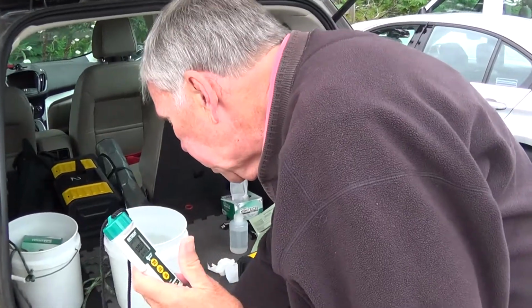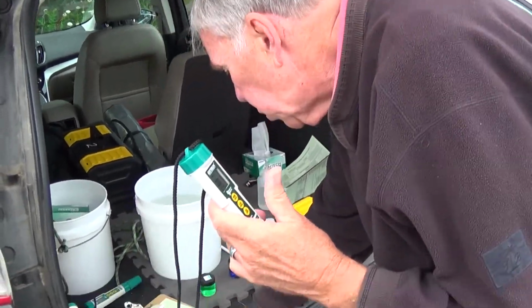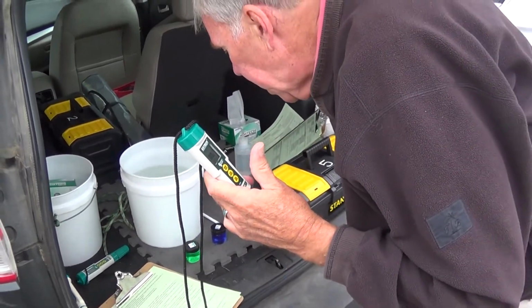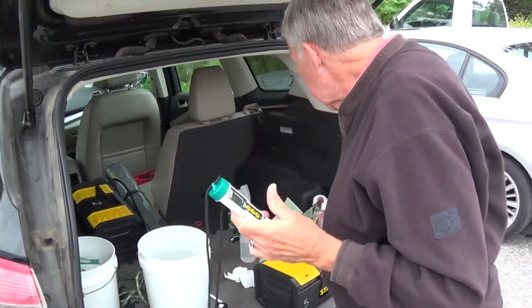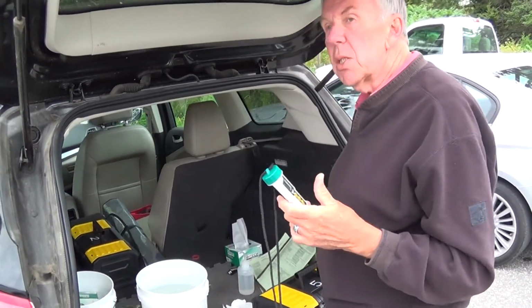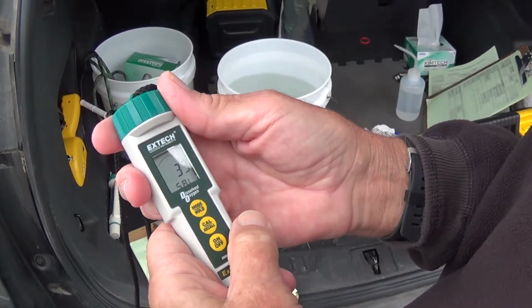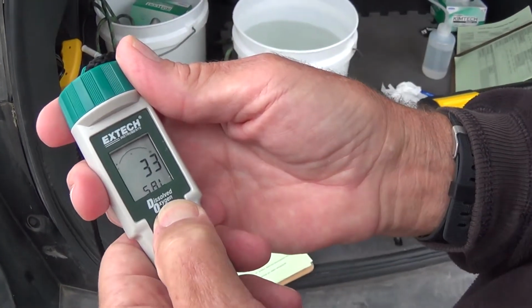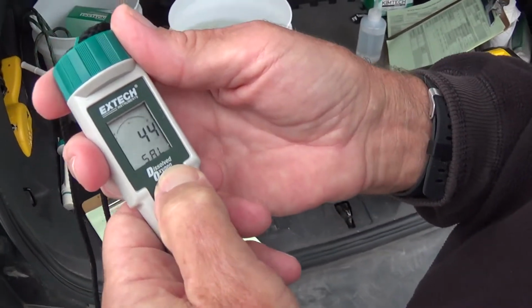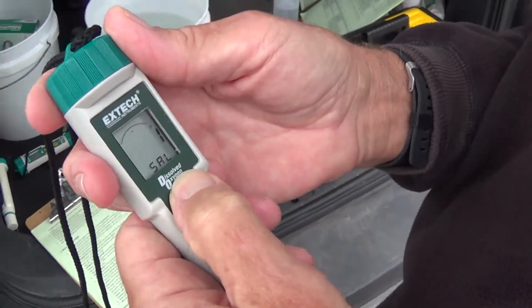You press the cal recal button twice, and then you press the mode hold button as many times as needed to reach the number that you recorded earlier, 31.8. In this case, it's going to be 32. Press this twice. So I have to get to 32. So I'm toggling all the way up to 50, and then it will cycle back.